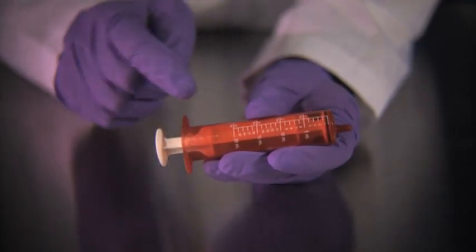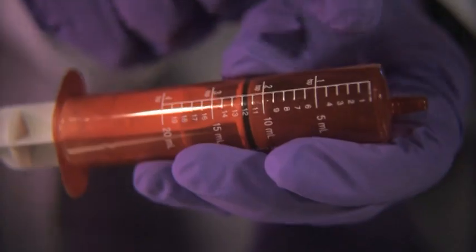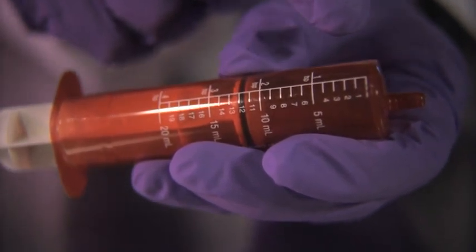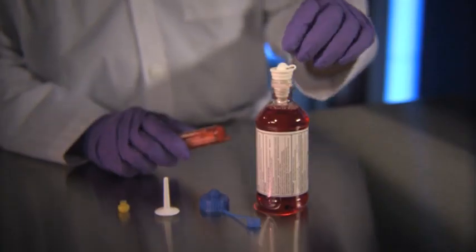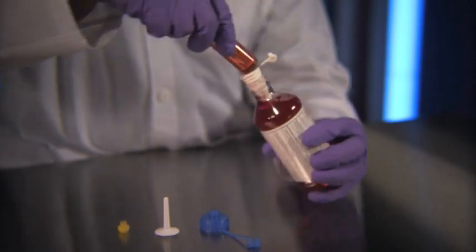They're comprised of a barrel and plunger, which are air and liquid tight, and have small volume demarcations along the barrel. Most often, you will use plastic oral syringes when compounding non-sterile preparations. Oral syringes have a large opening called a slip tip. This allows thicker fluids to be easily drawn up into the barrel. These syringes can also be used with a variety of adaptable caps to fit different bottle openings.